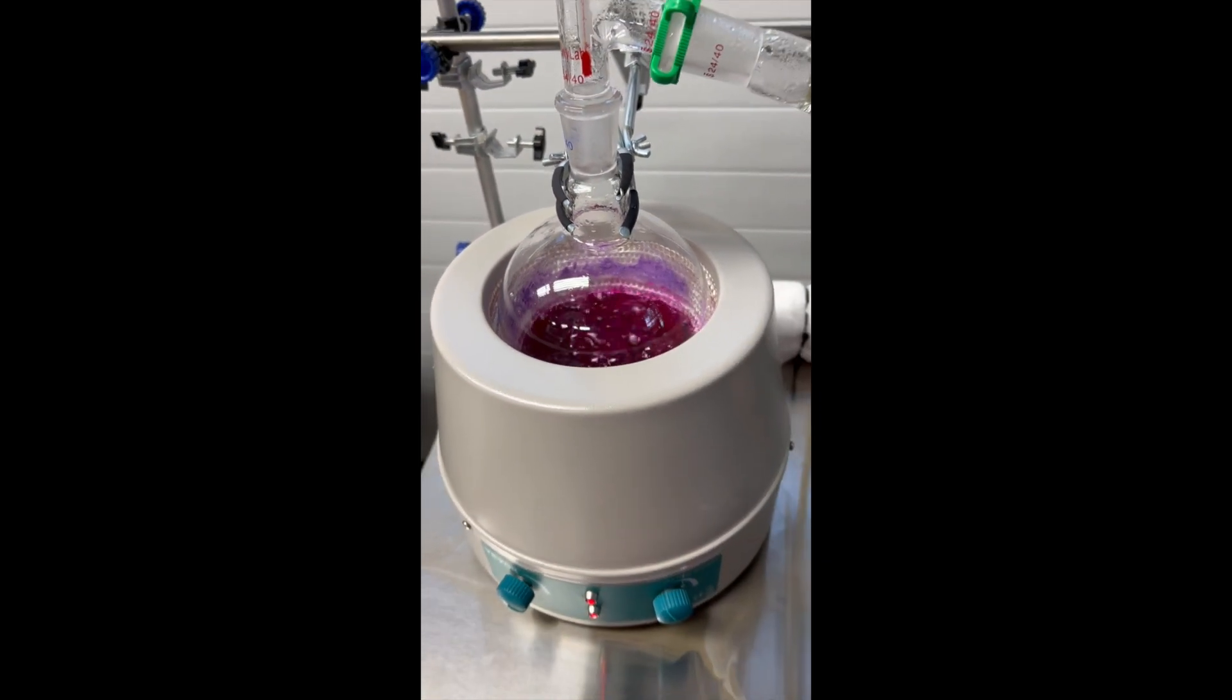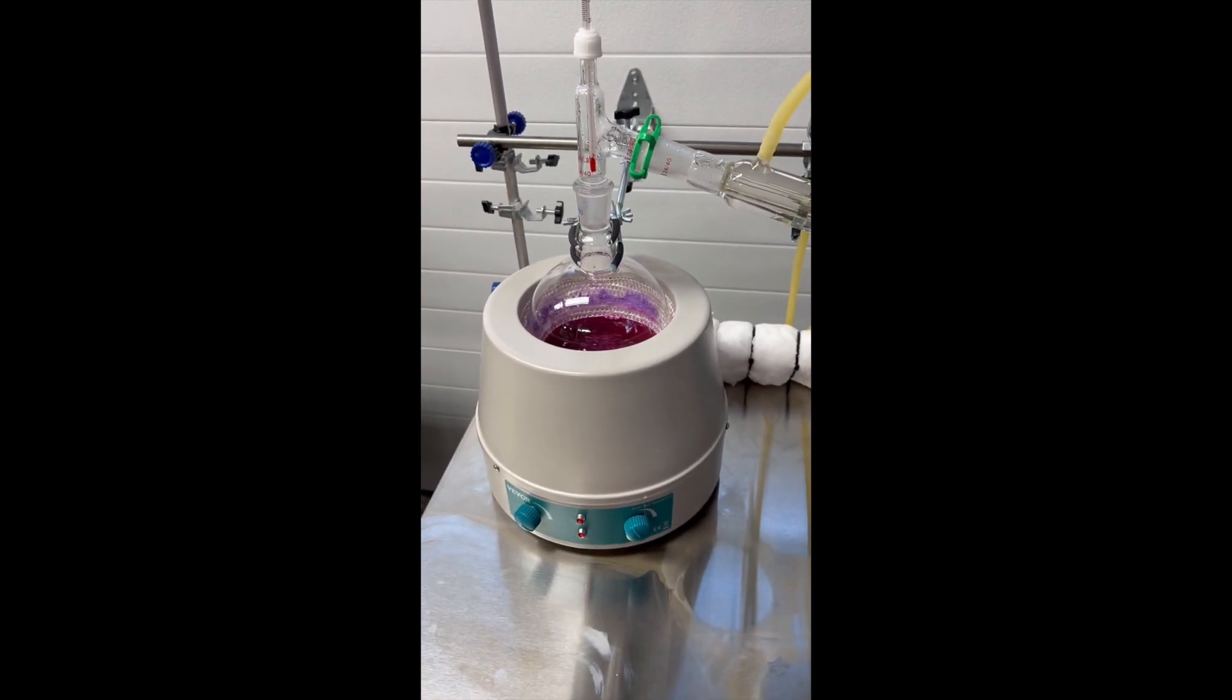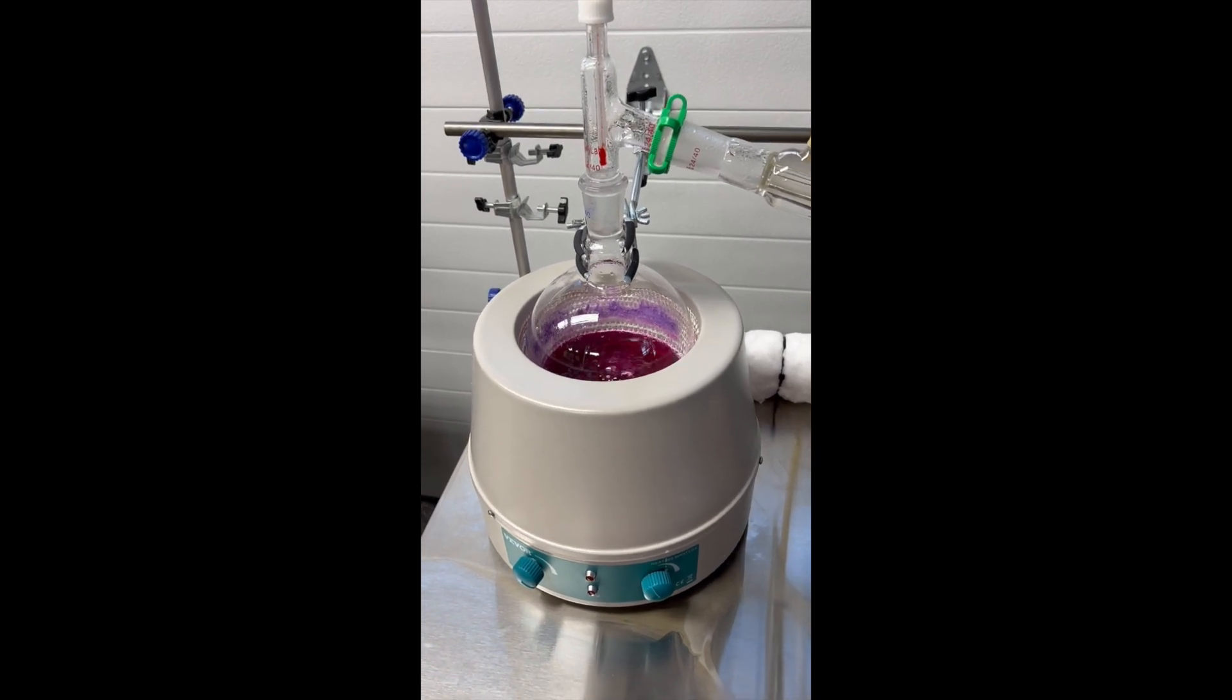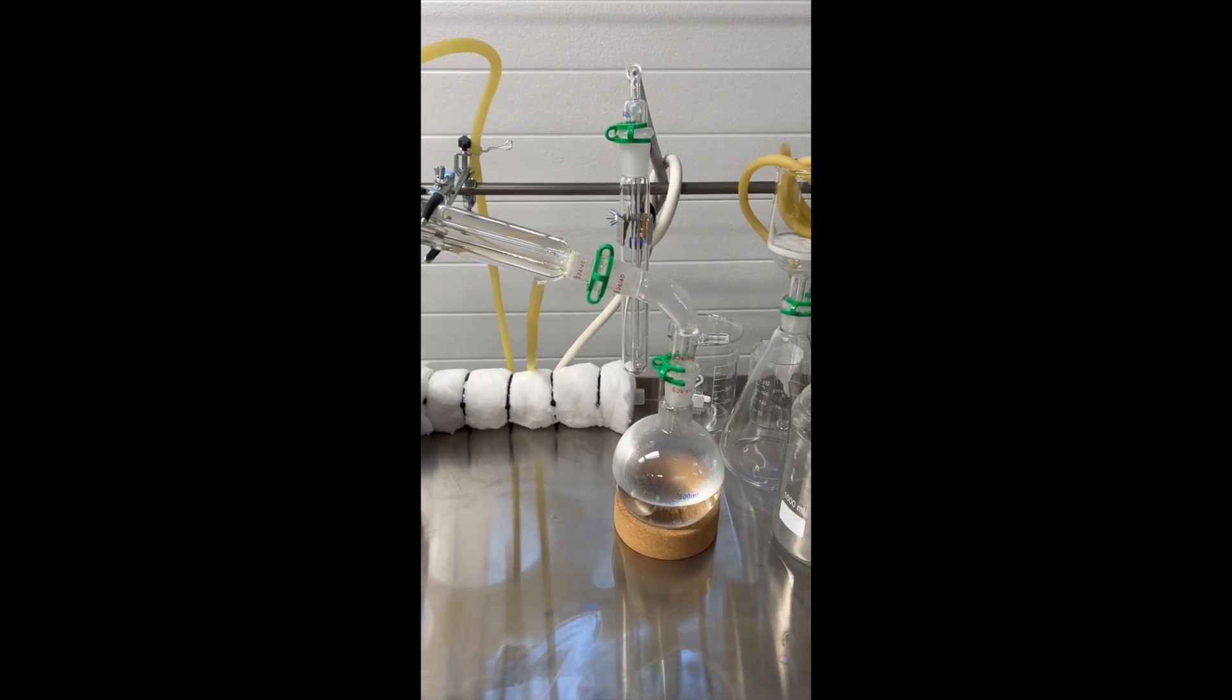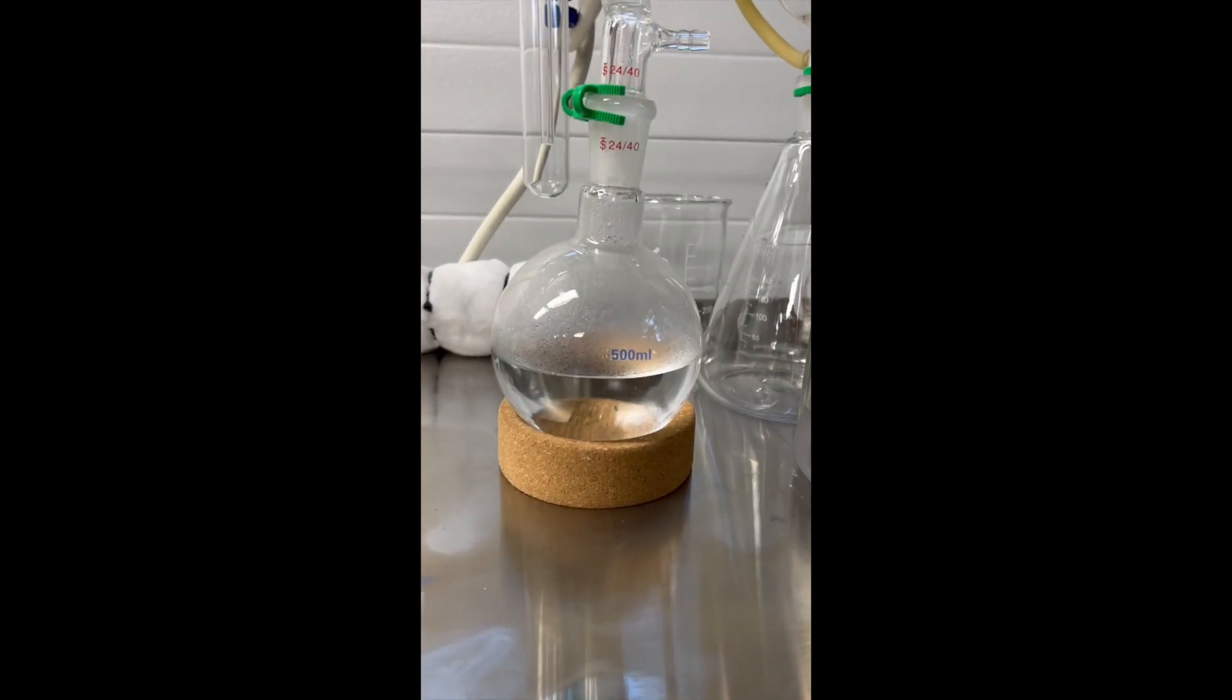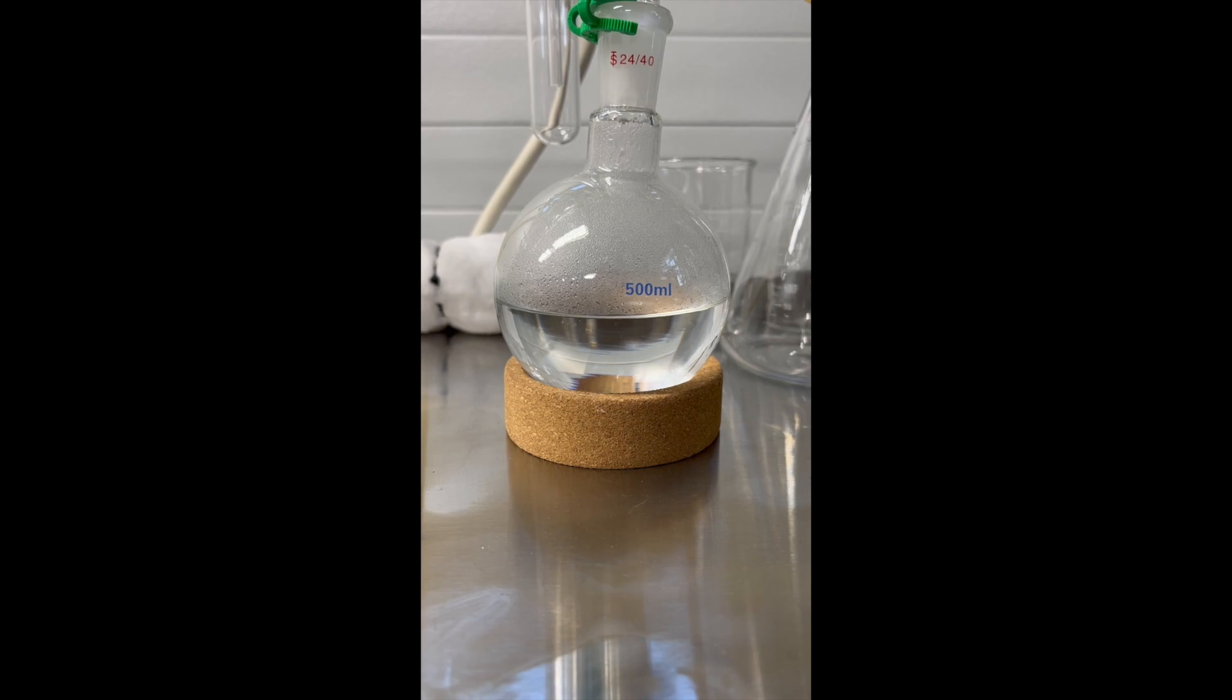So what I'm doing now is distilling out the salt and hopefully the concentrated deuterium oxide, the heavy water, into the receiving flask here.